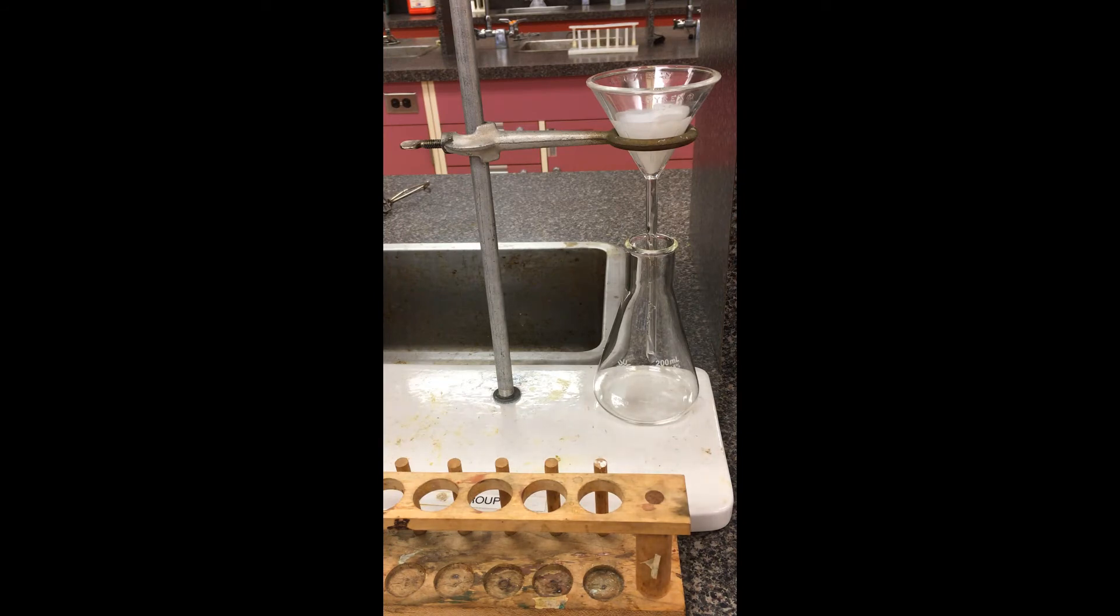Sometimes fancier funnels, we call them Buchner funnels, we can actually hook up an aspirator. We can actually use some negative pressure to suck the solution through to speed up the process. In this case here, we're just waiting on gravity to pull everything through.